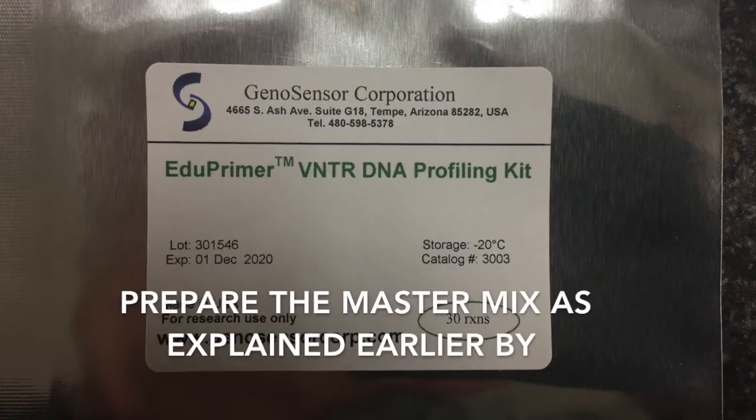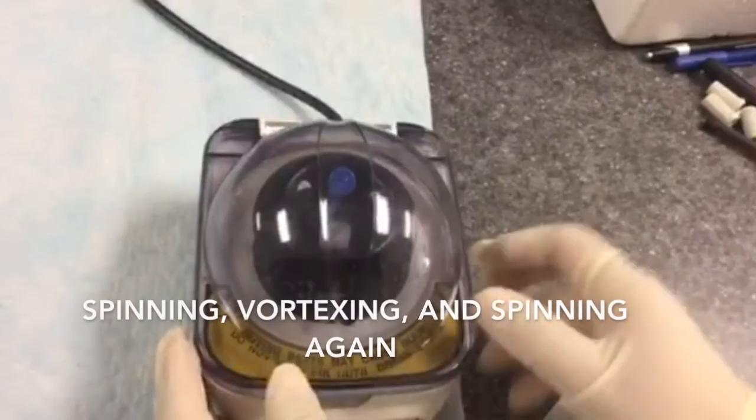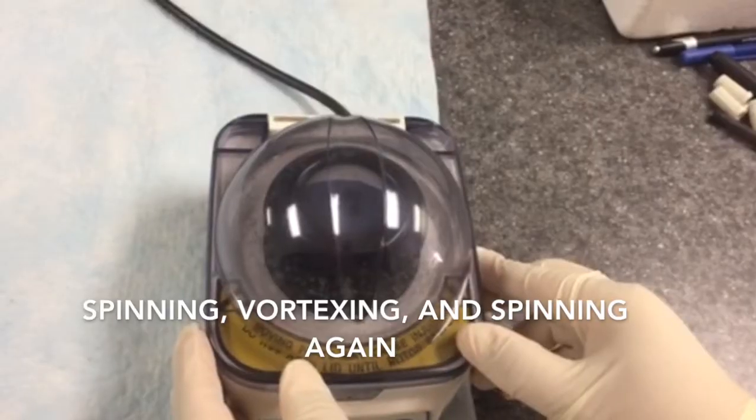At this point, if you haven't already, prepare the master mix as explained earlier by spinning, vortexing, and spinning again.